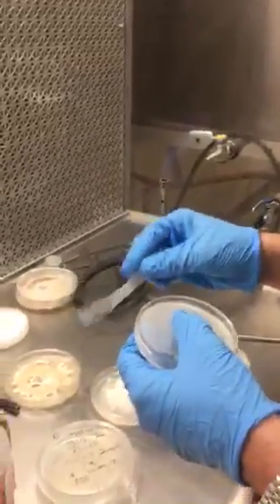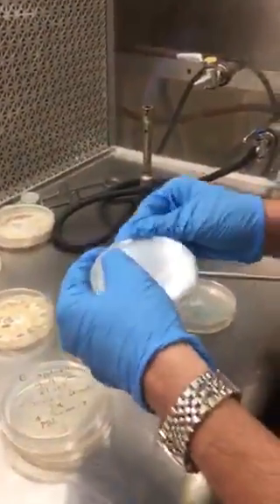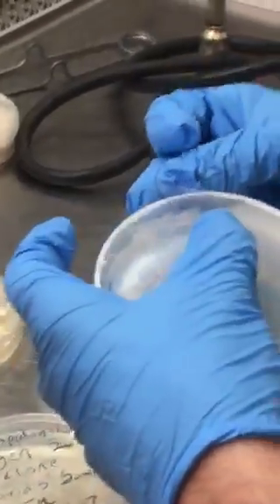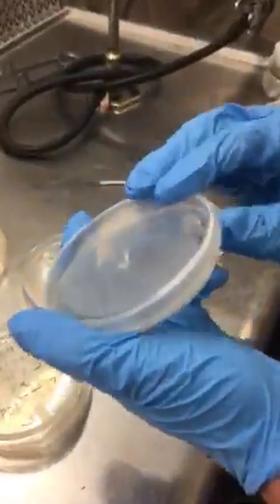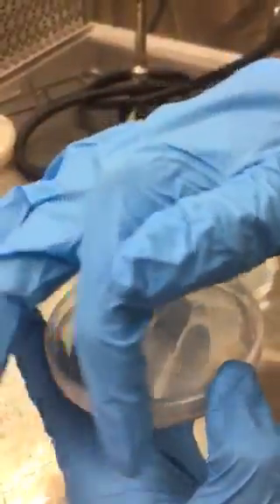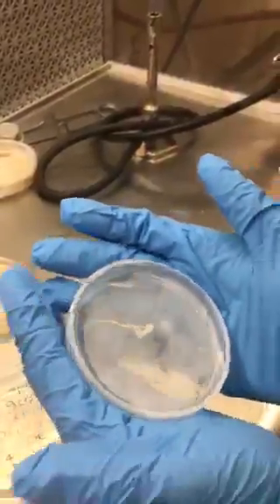These are pre-sprayed. I sprayed them with Lysol — it's a sterility chemical, an aerosol for sterility purposes. You spray it on there and it kills off the extraneous bacteria, spores, molds, stuff like that. And this should be your final product. When I did the parafilm, I just kind of pinched down the parafilm, spread it around, stretched it around, and then laid it down nicely, then stretched it back around to keep it even. You kind of do that by feel.